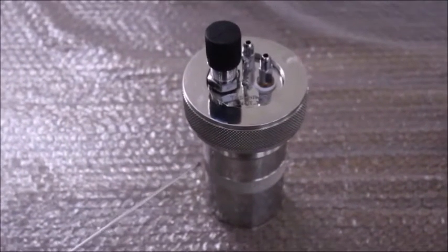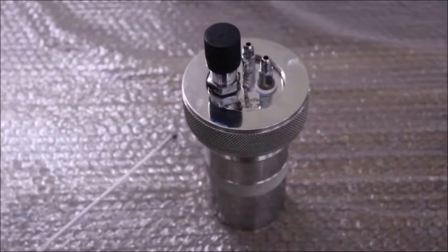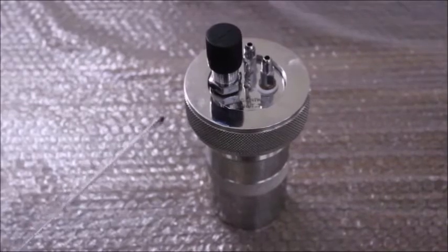The item that is being displayed at the moment is a combustion bomb. This bomb is the heart of the entire assembly and it is inside this device where the combustion reaction takes place.